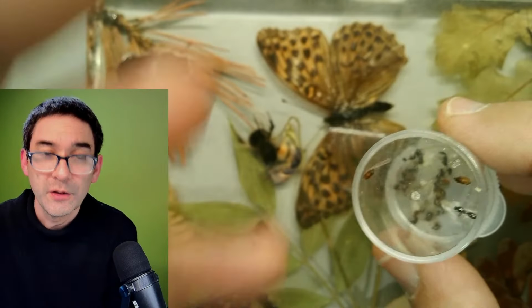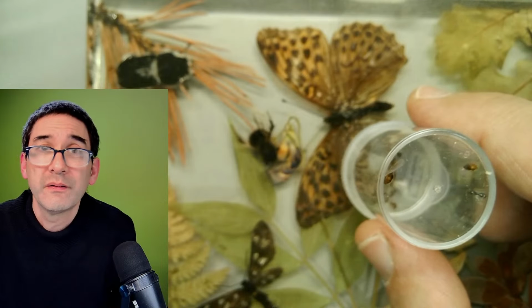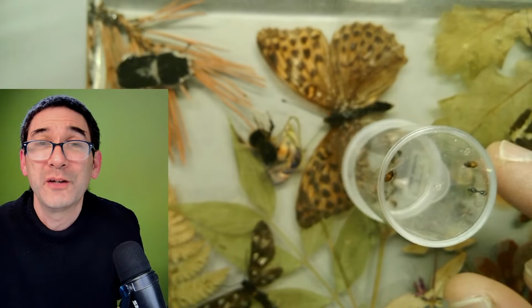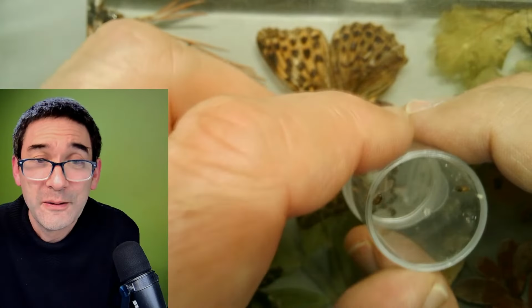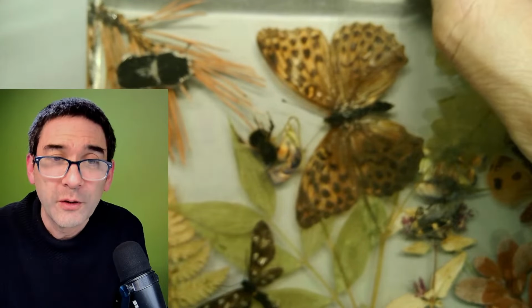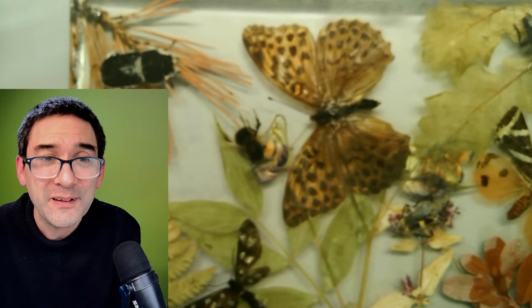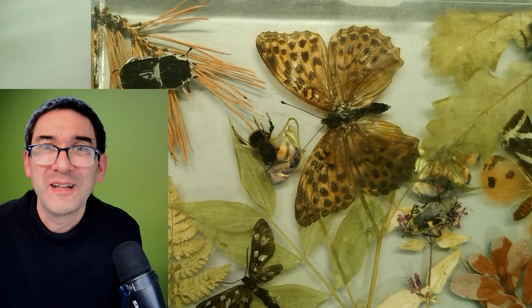And for me, those live streams are, in case you're wondering, also a way to simply play around a little bit and to look at things that I normally probably would not look at. So that's also one of the reasons why I'm keeping the format of these live streams a little bit open, and doing some experimentation and lab work on the fly.